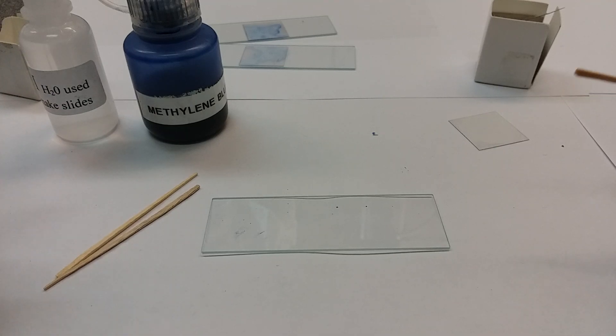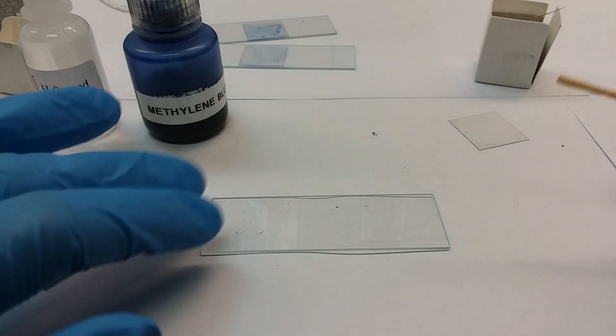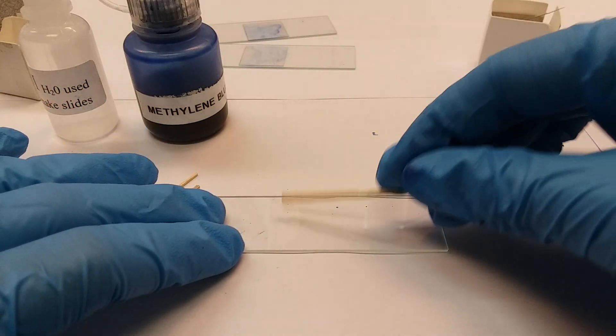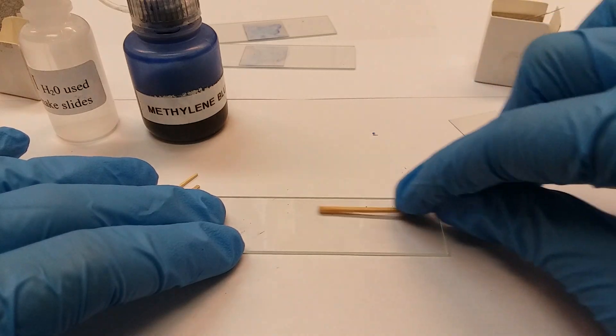The instructions say to use a whole droplet of water. I don't do it that way - I do it a little bit different. I've noticed it's not giving me good results that way.